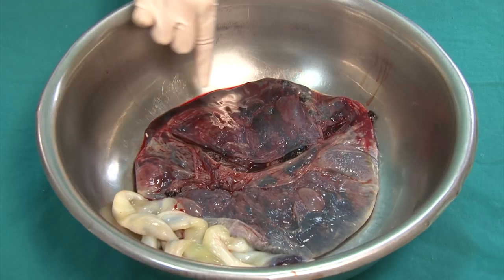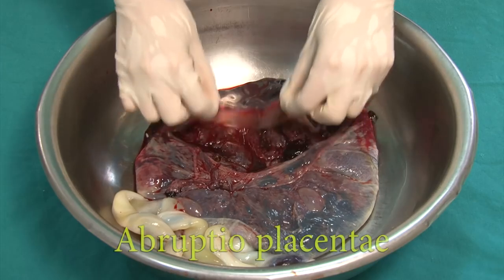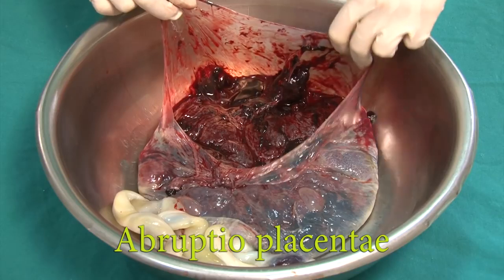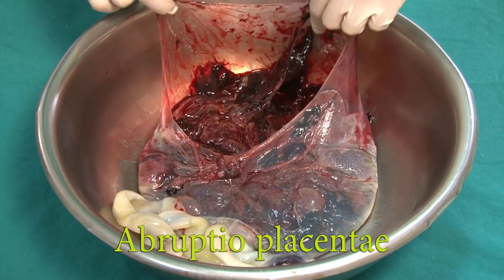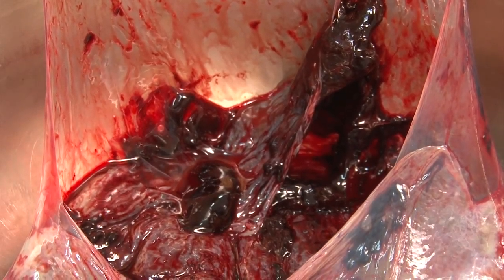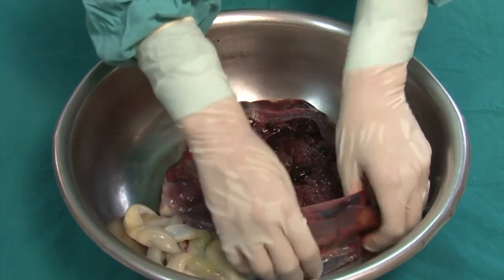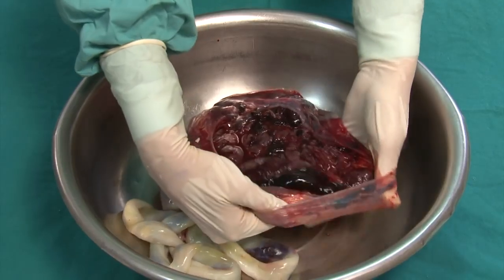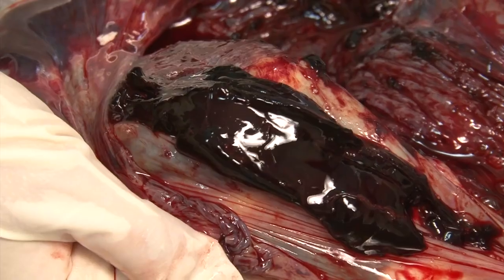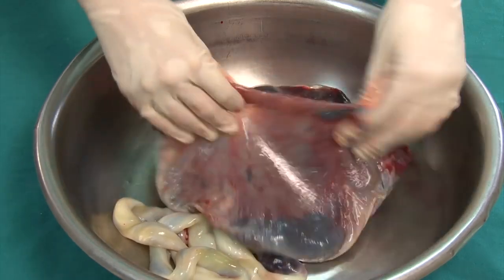In this case, dark blood clots appear through the turned-over membranes, indicating abruptio placentae. When lifting the membranes, the clots can be seen adhering to the placental edge and adjacent membranes. This is a sign of a marginal abruption. There are even more clots which become visible when the membranes are turned over, some in the central area and a large one at the opposite placental margin.